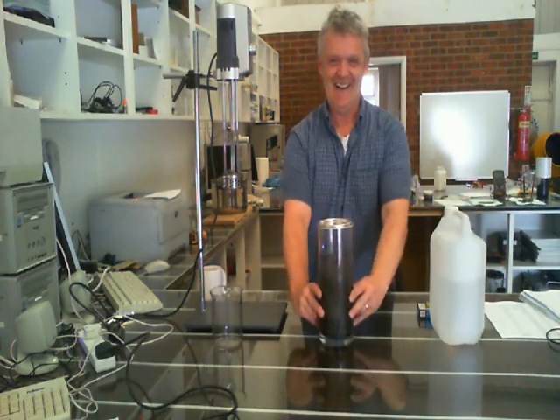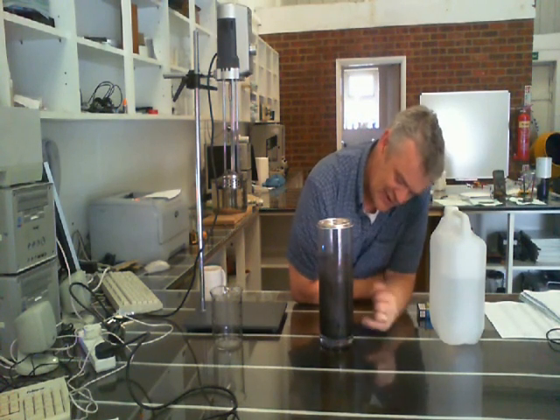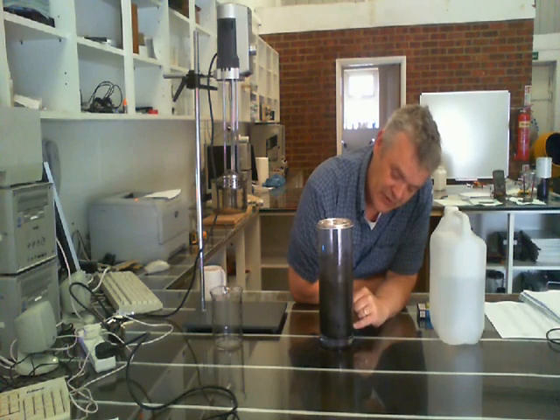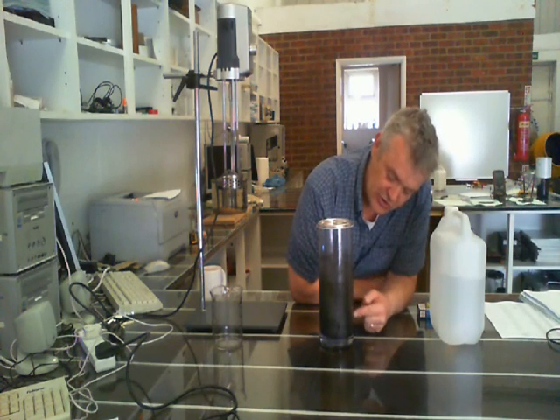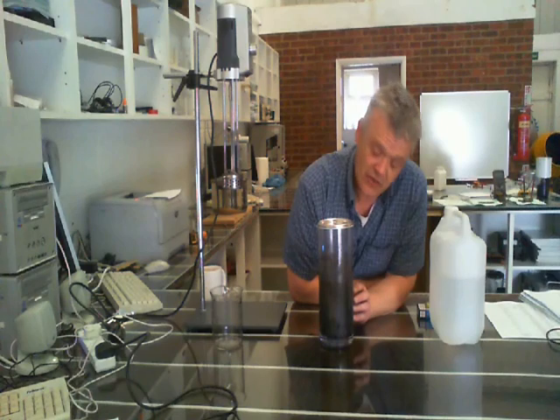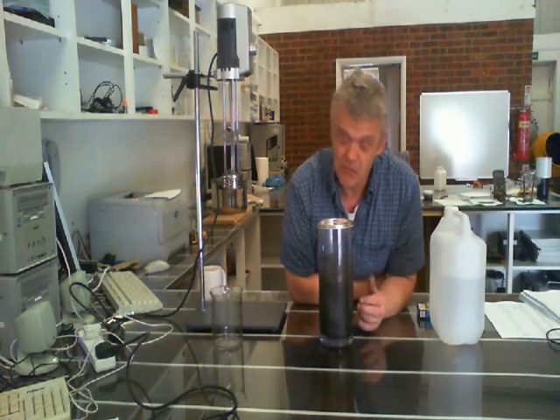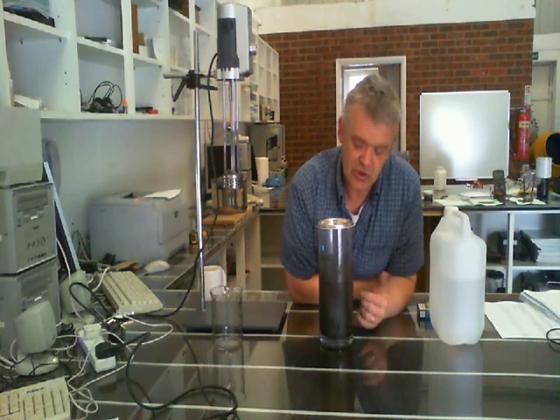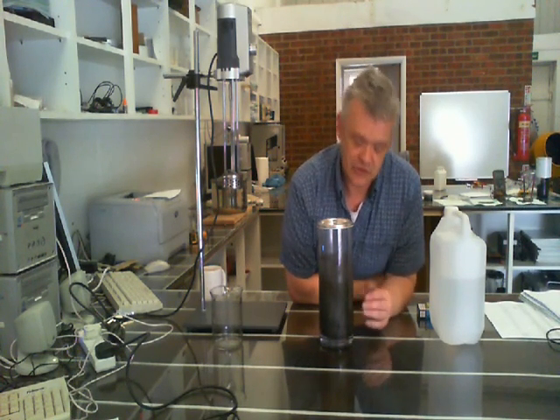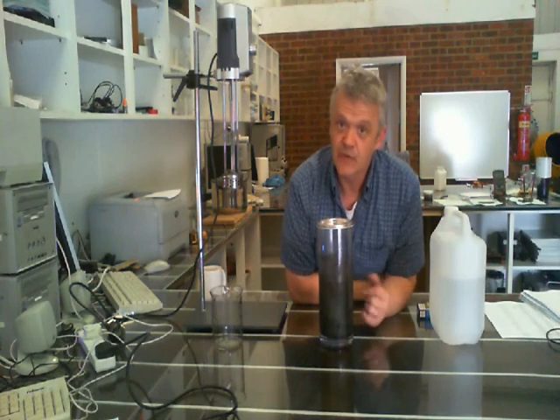This is what I got! That's been sitting around for about two weeks now, just so that I could do the test on it. You can see that there's a little bit of separation going on at the bottom, and you can see that the solution is very concentrated graphene — that's about 4 mg per millilitre. That's been stable for about two weeks now. What I need to do with it is put it through a centrifuge at 1,000 RPM to centrifuge out any more of the large agglomerates, to leave me with pure graphene in the acetone-water solution. That's what I'll be doing now after I've given it time to settle so I can see what kind of stability the solution has.